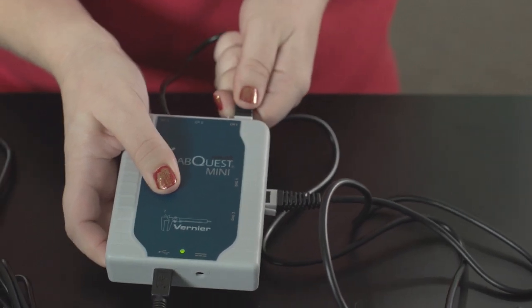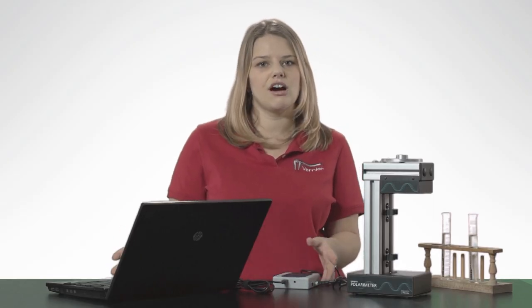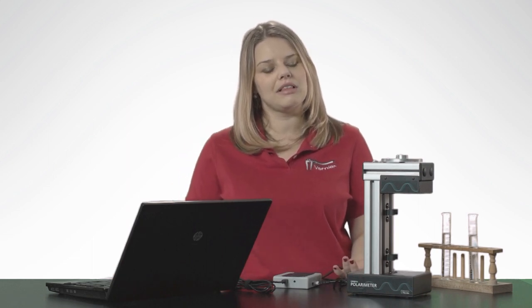Today I'm using the LabQuest Mini with a computer and Logger Pro, but you can also use it with LabQuest.